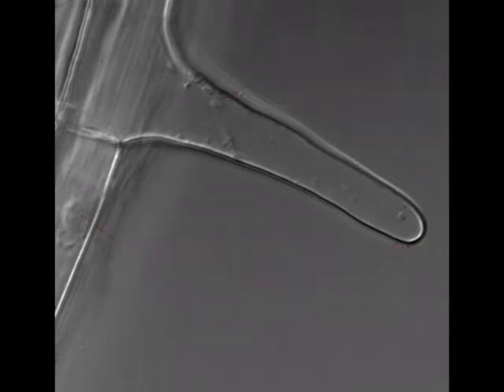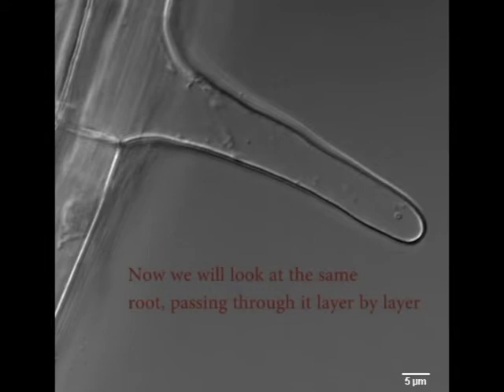Next we'll move into a time lapse of the DIC. Towards the end you'll notice that the branch begins to dissipate. Following this, we'll go into a Z-slice of our DIC. This will allow us to see layer by layer each part of the depth of the root hair.